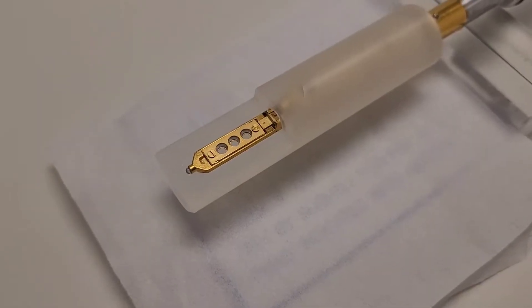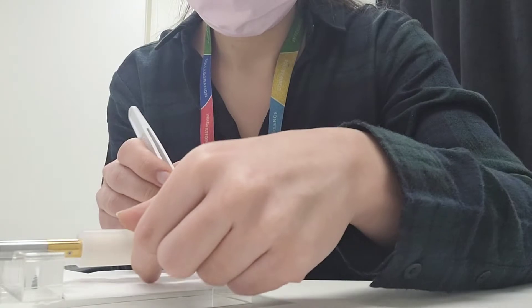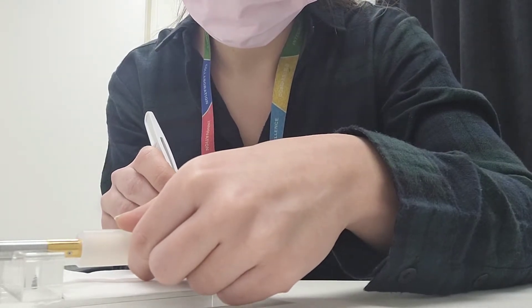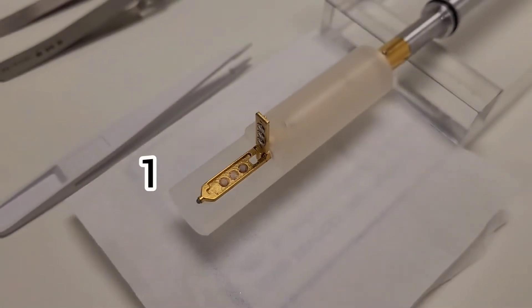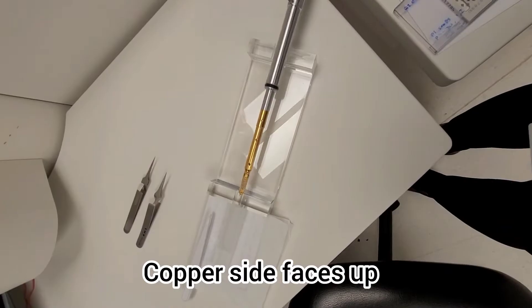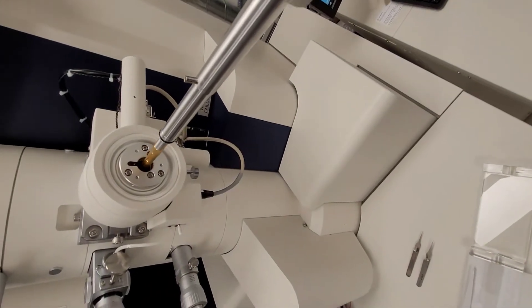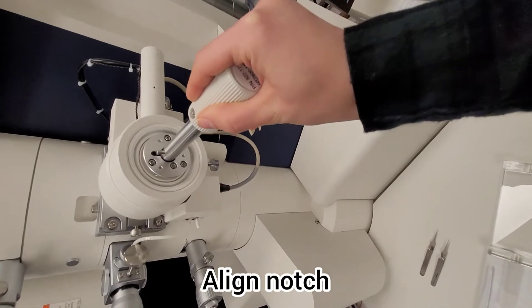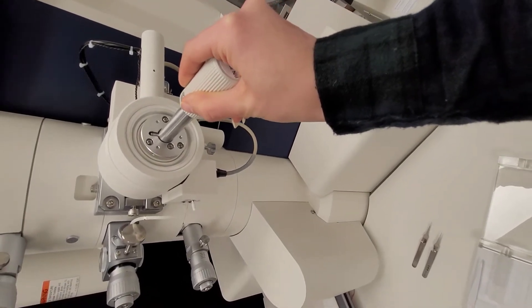Meanwhile you want to load your samples onto the probe. As I mentioned, you can load three samples. They have to be the copper side facing up, and you just insert the probe until it stops.